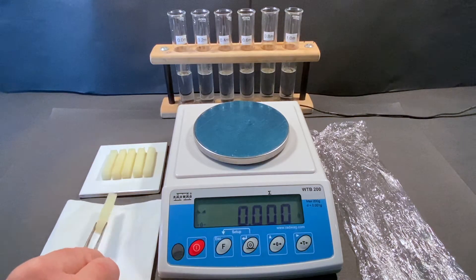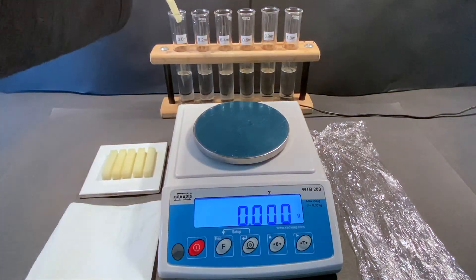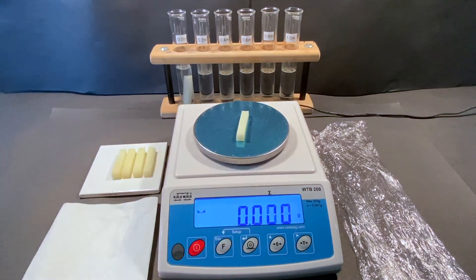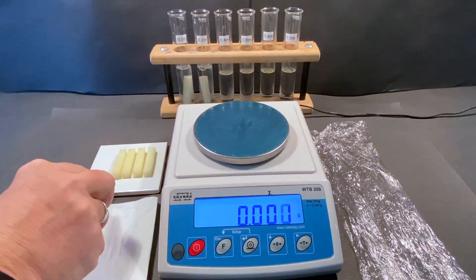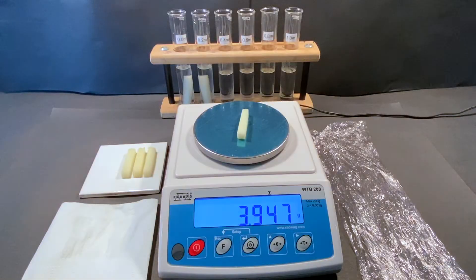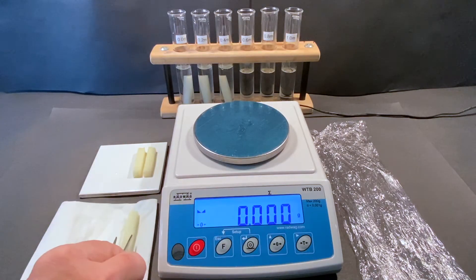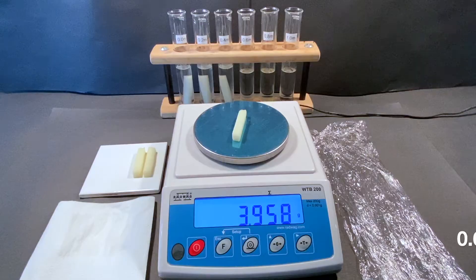Blot any excess liquid or starch from the surface of the potato section. Ensure that the weight of each section is correctly associated with the concentration in which it will be immersed. As each weight is registered, an on-screen caption will associate it with the concentration. From the raw data shown on screen, tabulate the results using SI units.